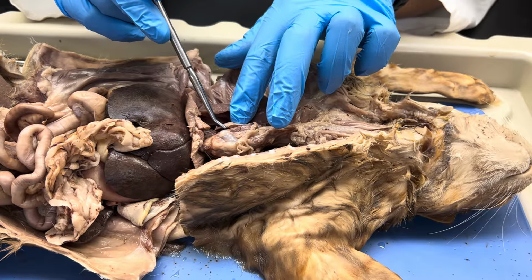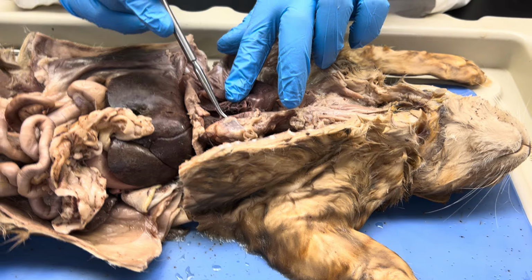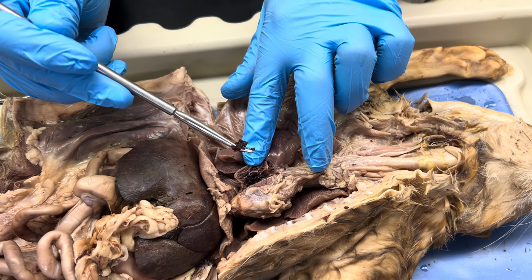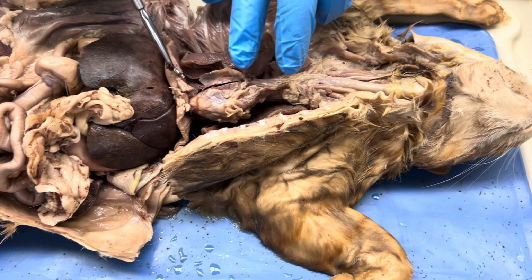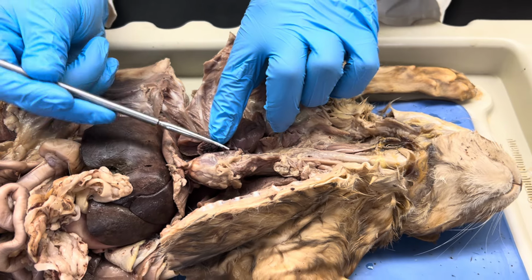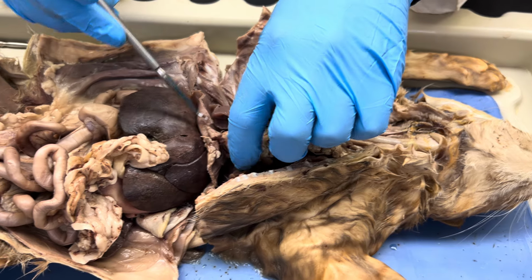You have the heart, which you can see, actually been kind of cut open here, so it's got some blood inside of it, but this is the heart here. See the wall of the heart? The blood that I'm pulling out, that just was left. Oh my gosh. Why is it so big? It's clotted. Clotted? Yeah, it's clotted. So blood, the immune system's rocking. So you got the heart here within that pericardial cavity.